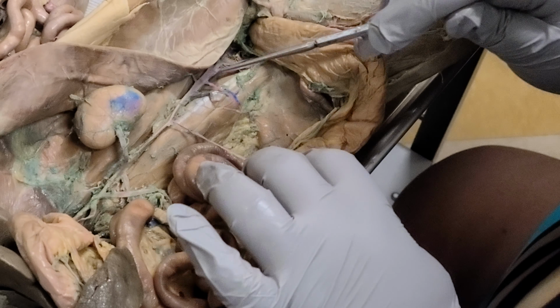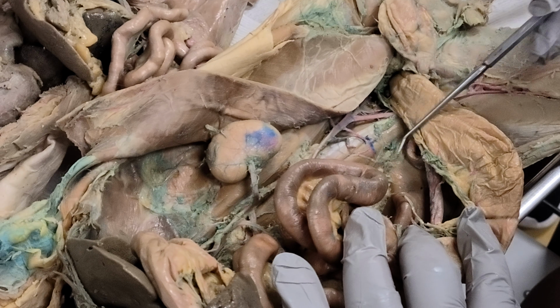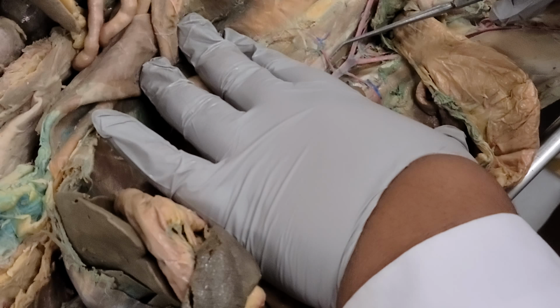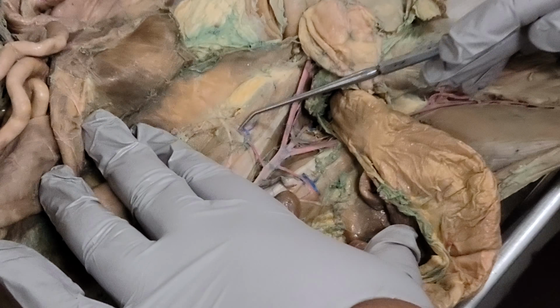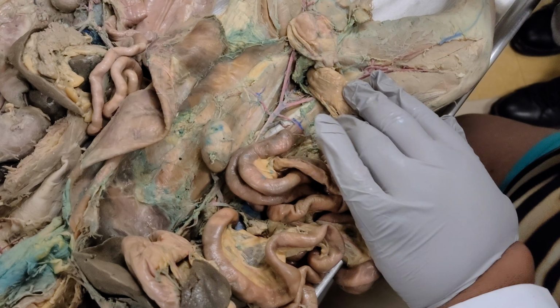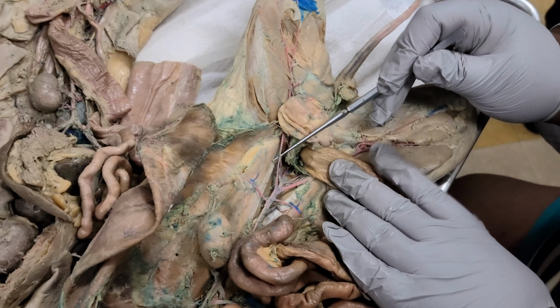Does he have one leading into the colon? Let's see, there's none connected to the colon. Oh my gosh, they cut him up. Yeah, see? So it's been cut off, the inferior mesenteric. But he does have a good iliolumbar. You see how tiny it is? It's plaqued on the dorsal body wall, so you can't move it. It's on there. Now here's the intersection that I was referring to.